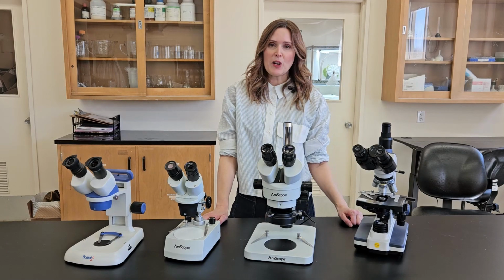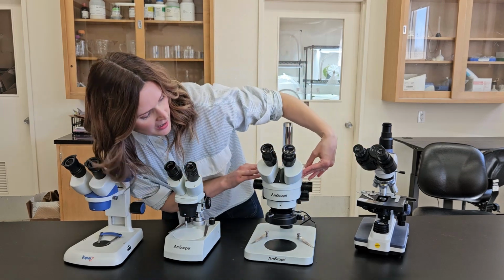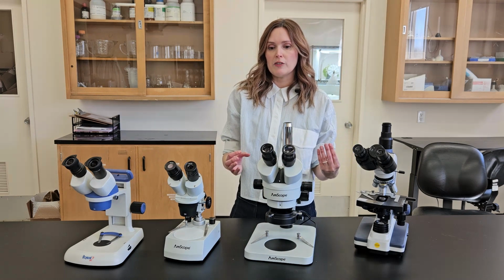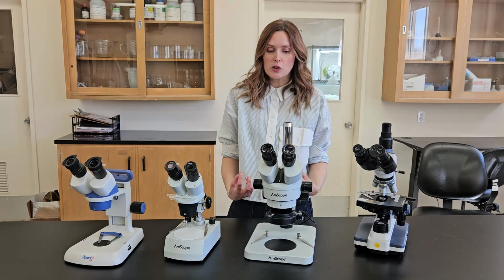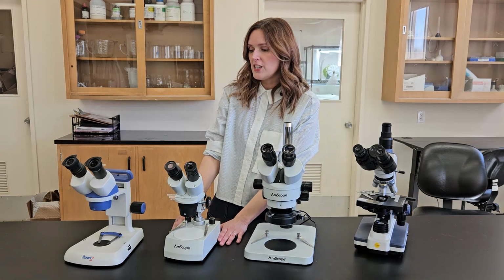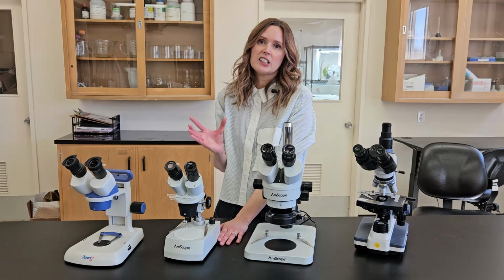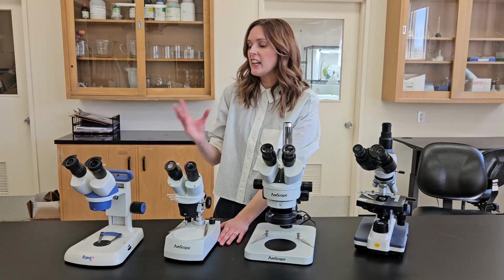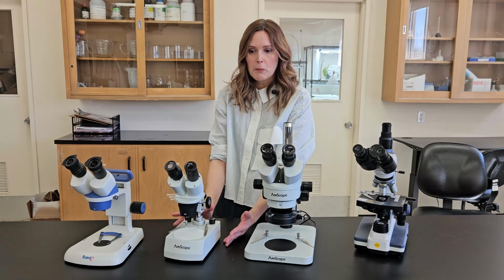Okay, so to wrap this up and talk about which microscope you should choose, I would personally pick this guy, which is an AmScope. This is the $400 to $500 one. It's very similar to the several $1,000 one we use in the lab, but obviously it's cheaper, and it's pretty indistinguishable in terms of its sturdiness and its clarity. The only time I would pick one of these two cheaper ones, which I personally find a little bit more frustrating to use and with a little less clear picture, is if you were transporting them a lot, like taking them to different farms, or needed it to be not plugged in sometimes, maybe for demos.